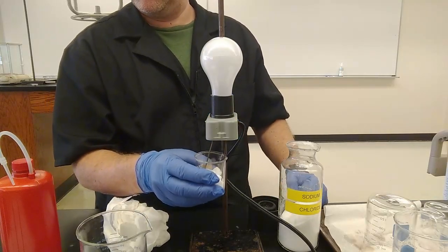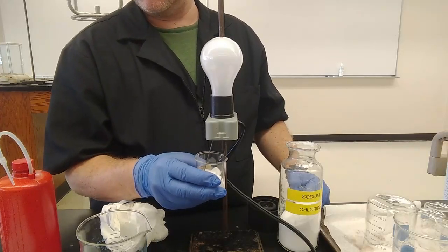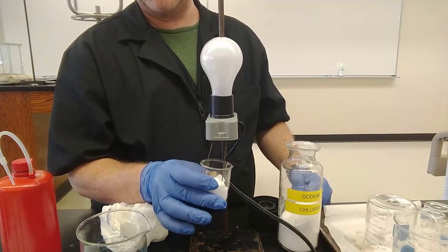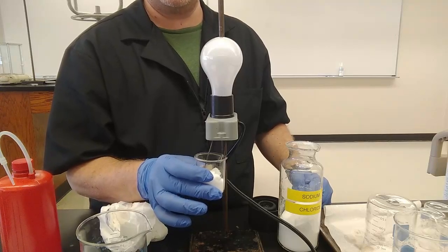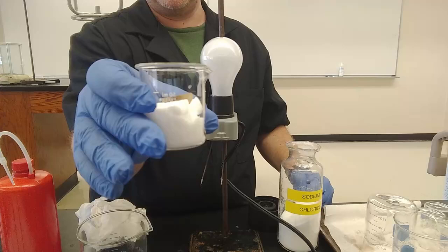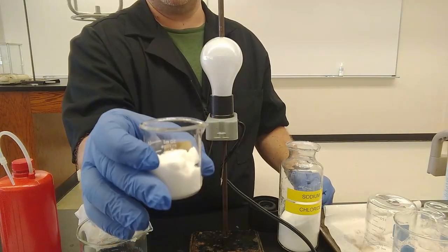Nothing. Now you'll note in the final column, conclusion, strong weak non-electrolyte, I put a line through it so that you couldn't conclude anything about this. And the reason that I did that is because of the definition of an electrolyte: a compound which, when dissolved in water, conducts electricity. This is solid table salt. There is no water. It doesn't fit the definition.